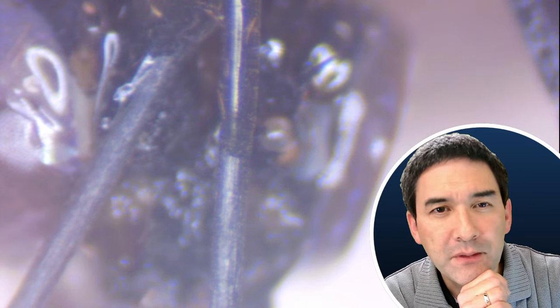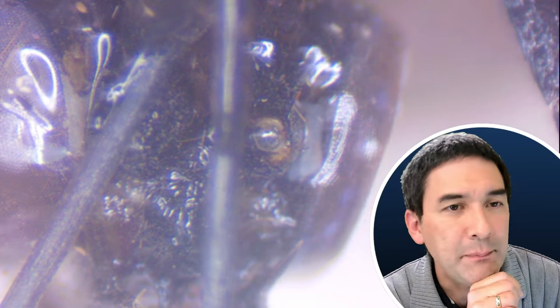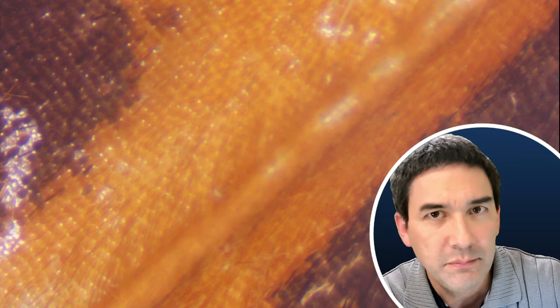I'm not really happy with the overall contrast. Normally with low contrast you do some contrast enhancement in Photoshop or GIMP before processing the images — it significantly improves quality. I'm not going to do that now, but rather just give you a demonstration of focus stacking using the head of this butterfly.